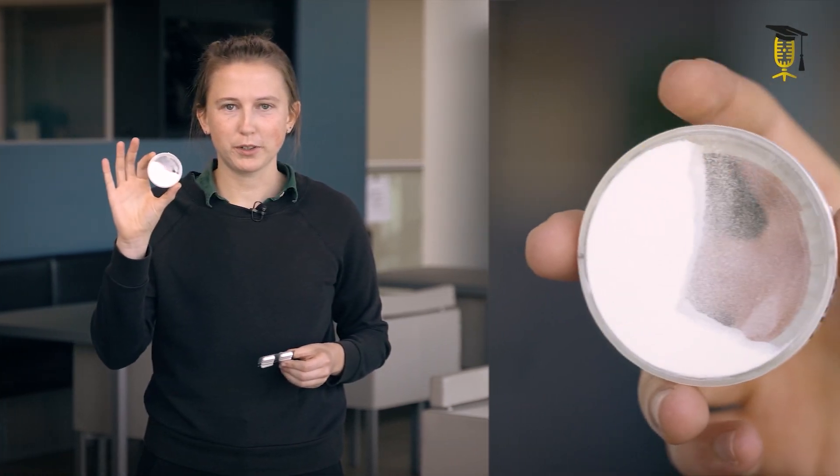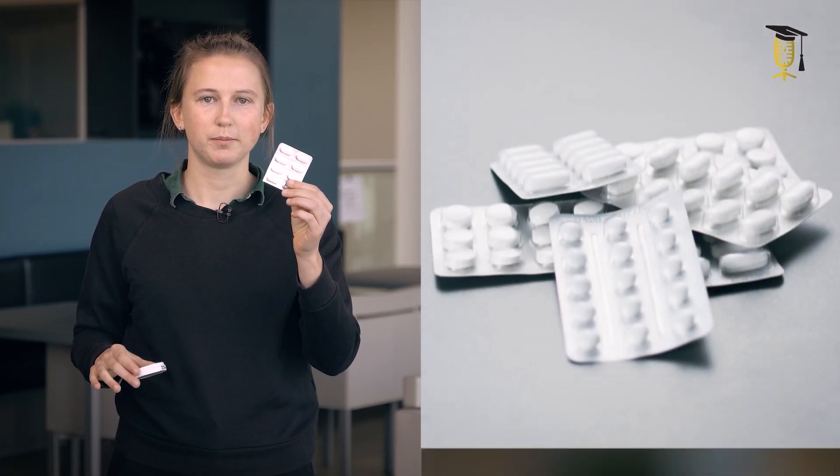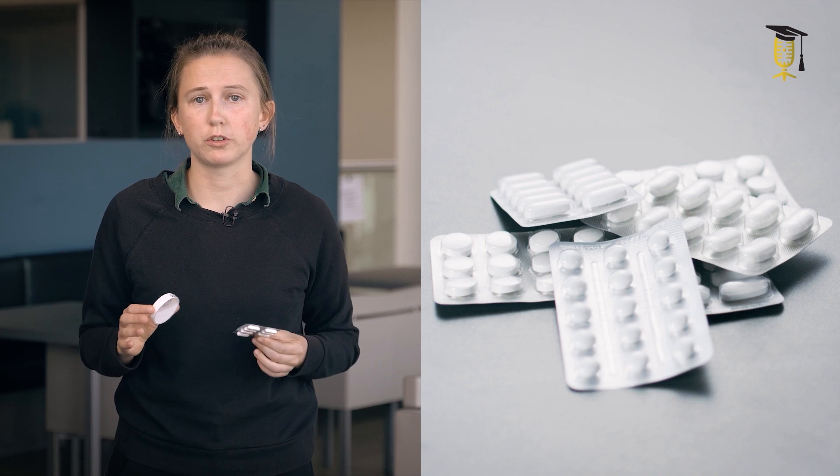With this powder, we can make these pills. It can be a paracetamol when you are suffering from a headache, or a novel cancer treatment, or any other pill.